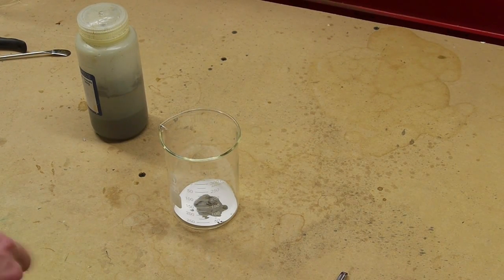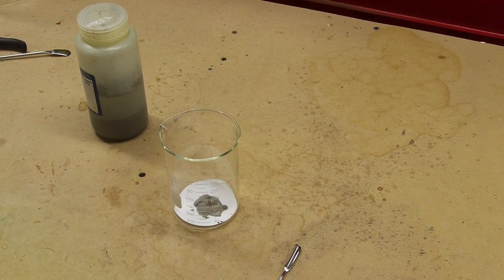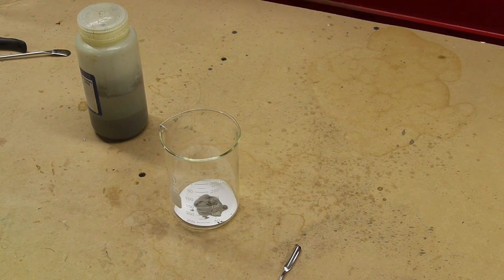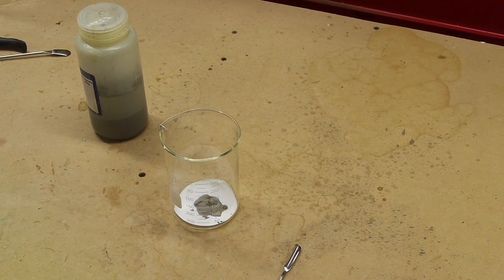And I came back and kind of very carefully fiddled with the powder with this spatula, and it didn't auto-ignite. And so then I put it over a blowtorch flame. And that ignited it all right, but I mean it was not quite as sensitive as I thought. I was half expecting the thing to just catch fire all by itself as it dried, but it didn't happen that way.